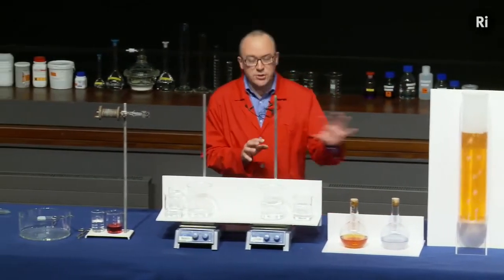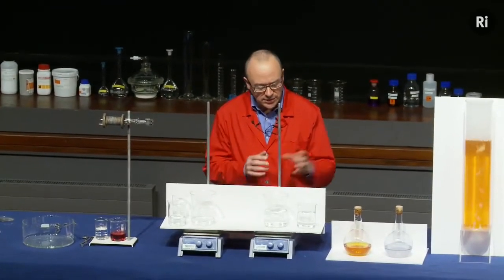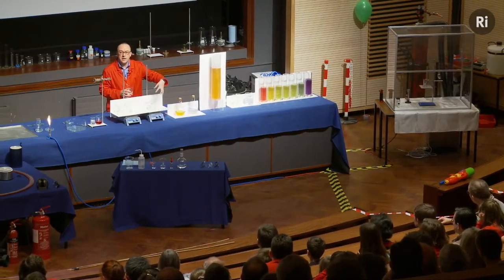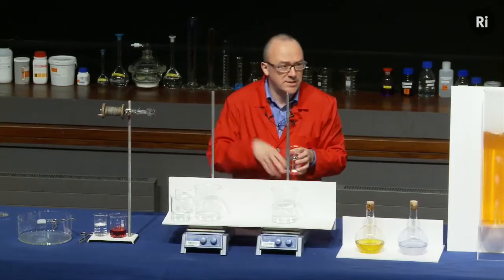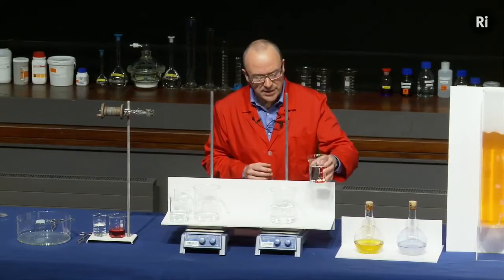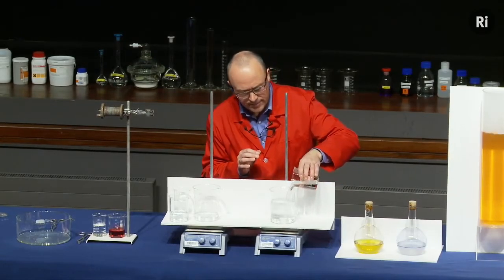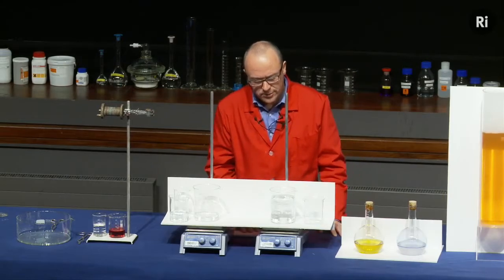So in the reactions we've seen so far then, we mix two things together and we got a colour change. So let's have a look at what happens when I mix these two colourless liquids together. So first of all, this machine is just called a magnetic stirrer. It just spins this little magnet and keeps the liquid stirring. It's just because I'm too lazy to stand here and stir them by hand. So we have a colourless liquid being stirred, and we add a second colourless liquid, and watch closely and see if you can detect a colour change. So keep watching.